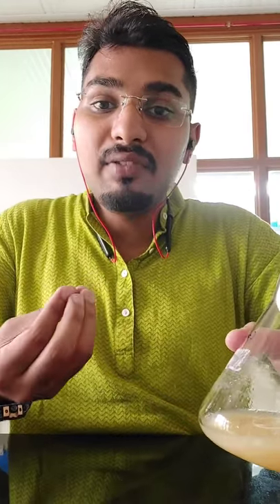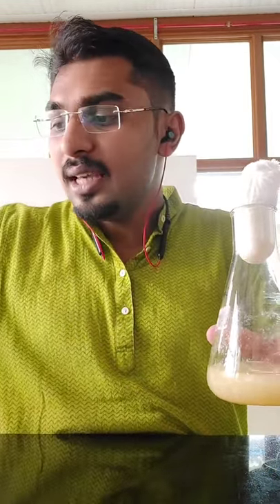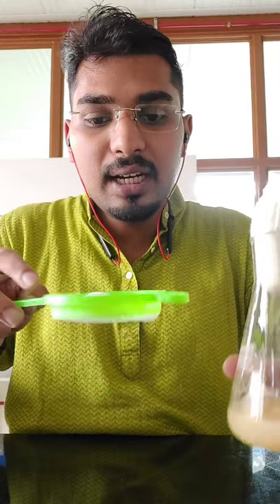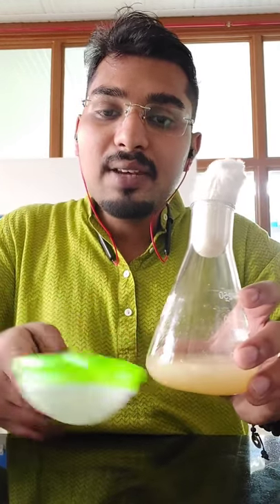Now the fungus is ready. The fungal body is in the form of hyphae or mycelium. What we will do is pour this into a strainer or filter — you can use a simple coffee strainer like this — and pour the entire media into it. Once you pour, the mycelium gets filtered and retained in the strainer, while all the liquid media particles pass through. You will then wash it with distilled water 2 to 3 times.